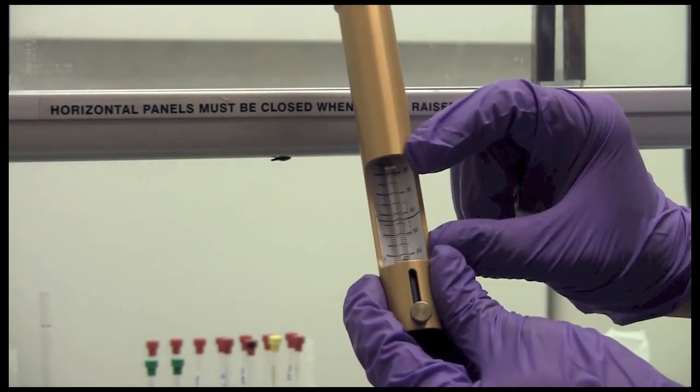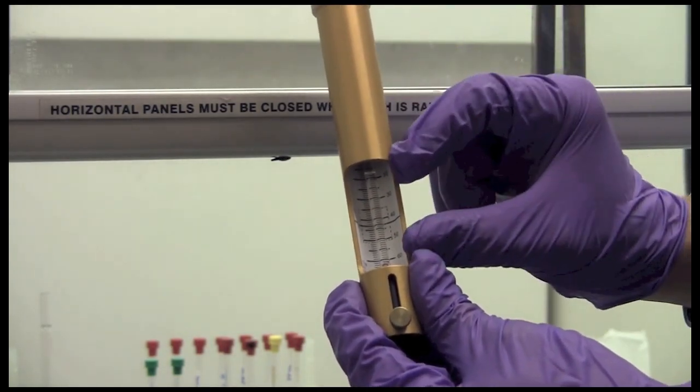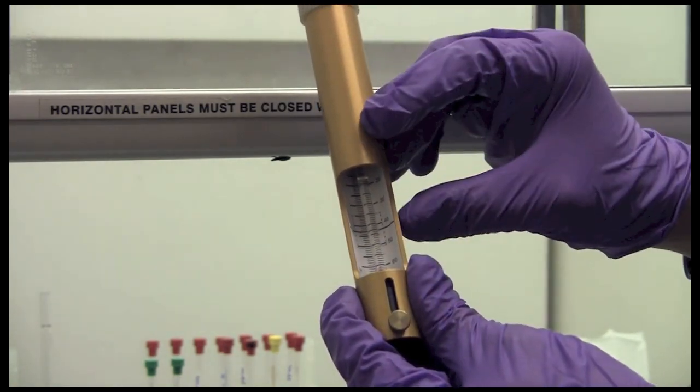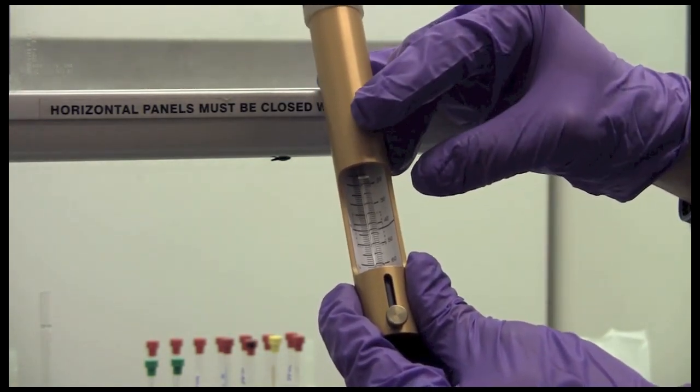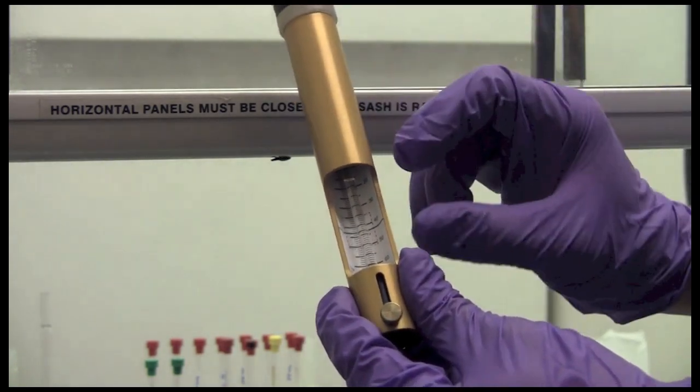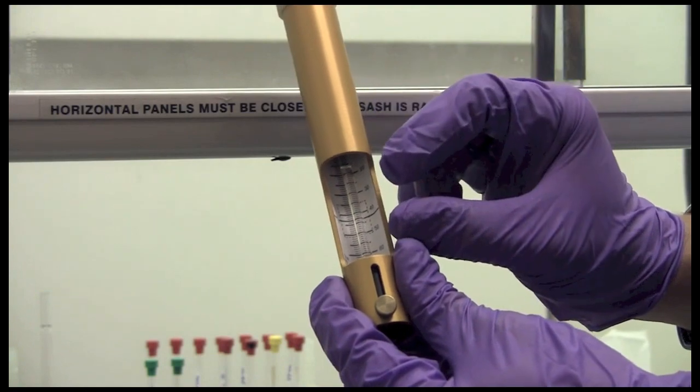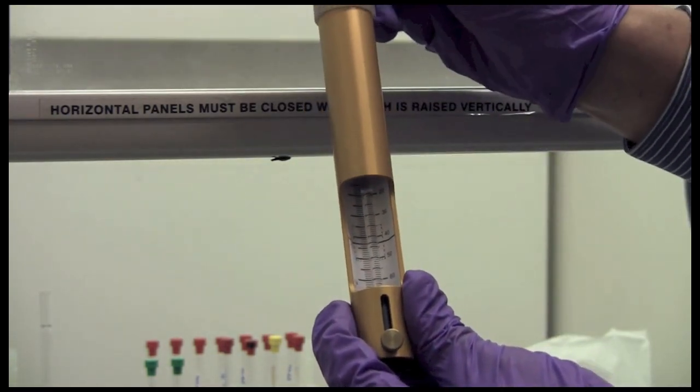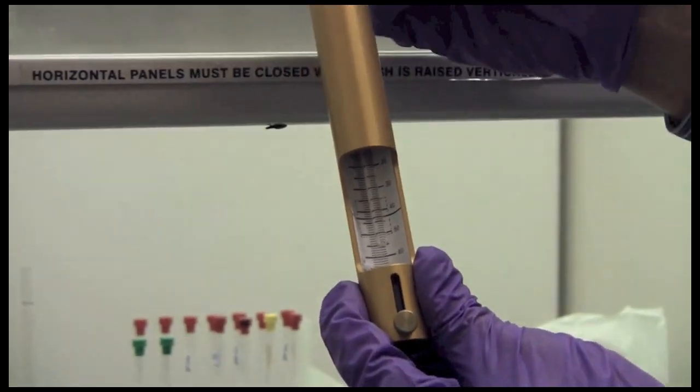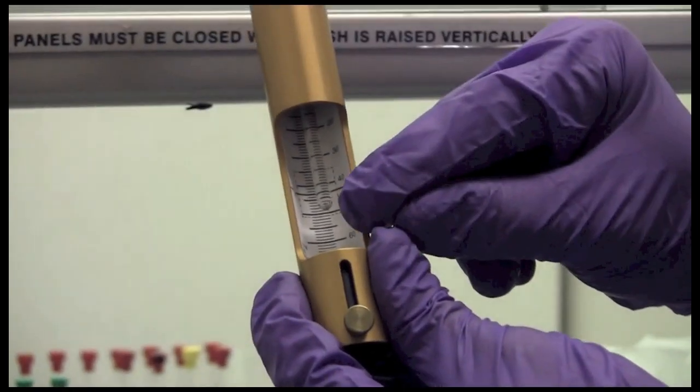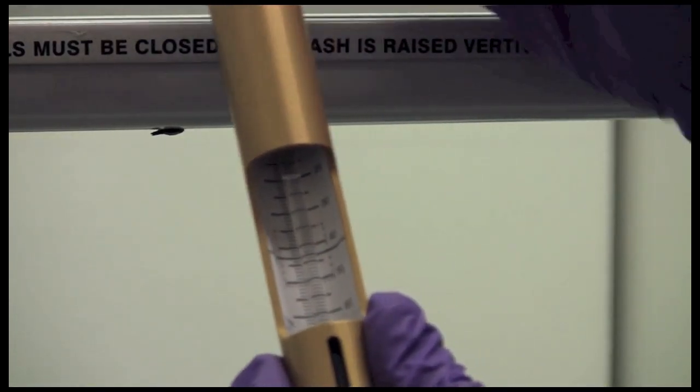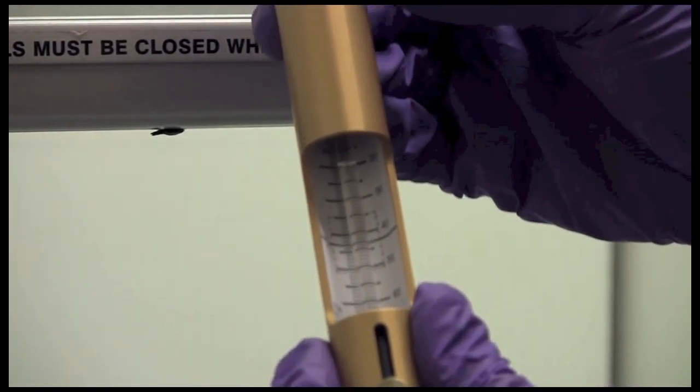The sample needs to extend out above and below the coil because the ends of the sample distort the magnetic field and cause the resolution to be worse on your sample. So if your sample is a little bit shorter then what you can do is not push it to the bottom but you can center it on the center line. However if your sample is too short then the ends will get too close to the coil and this will cause poor quality spectra. In this case it is tall enough and this would be fine.